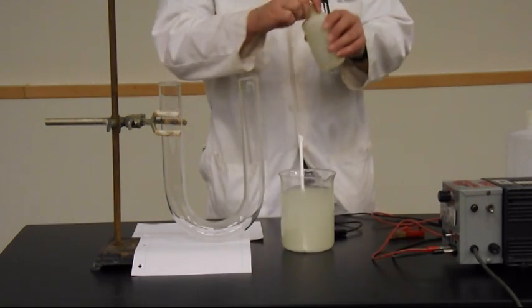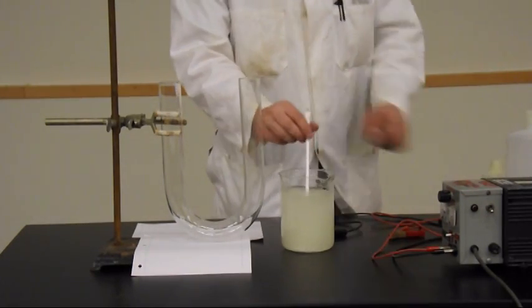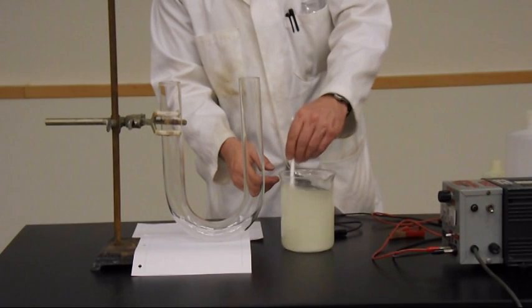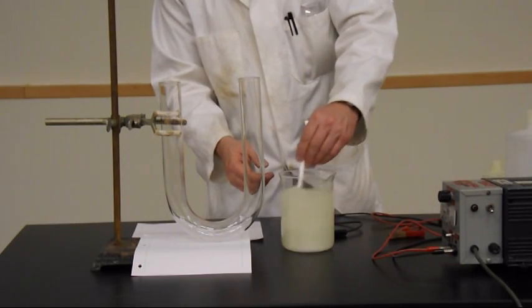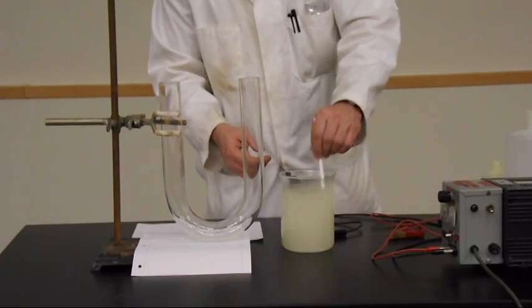I'm going to add a little bit of phenolphthalein indicator. This isn't like a titration so I don't need to be precise in how much I add. And we're going to let that dissolve.